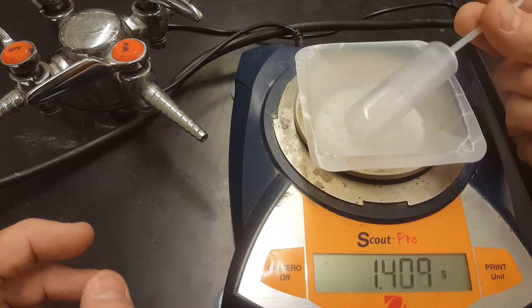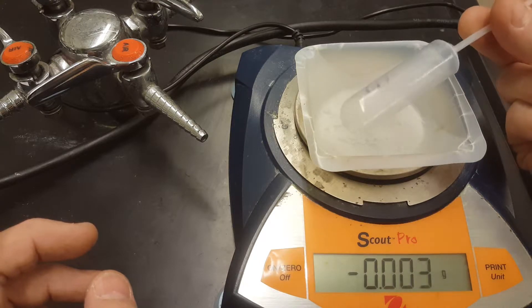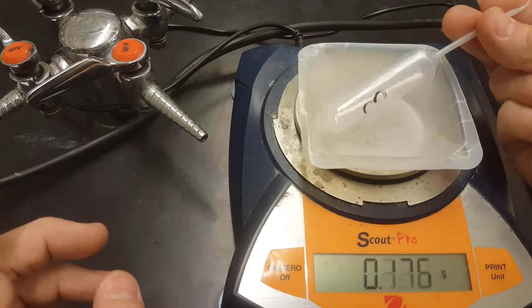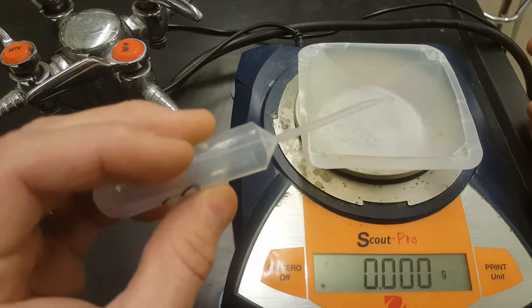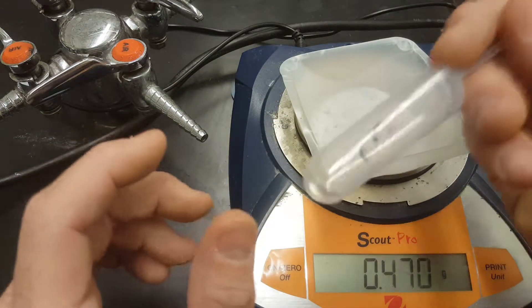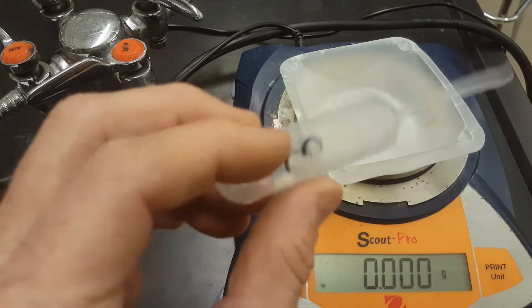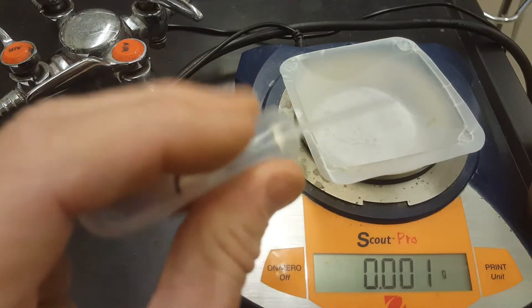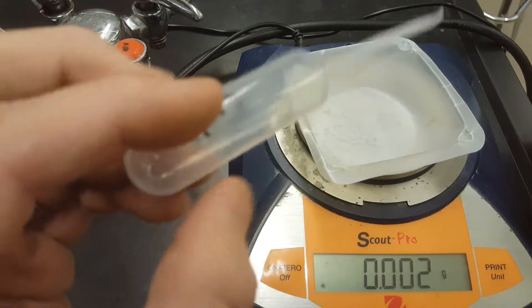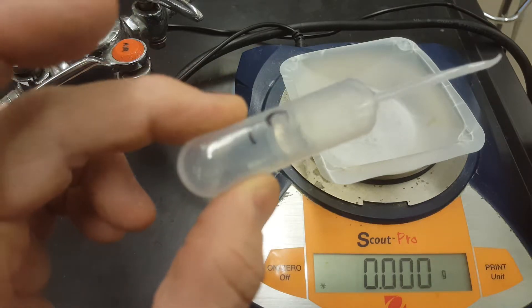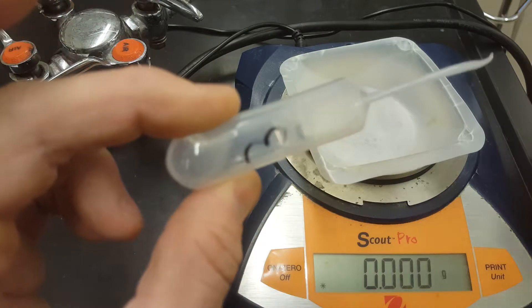If your pipette isn't perfectly dry and clean on the inside, then you can go over to the acetone and put a little bit of acetone, suck a little bit of acetone up into your pipette, shake it around. The acetone and the water will mix and when you squirt that out, the water will leave dissolved in the acetone. And it's one way to expedite the drying of your pipette.